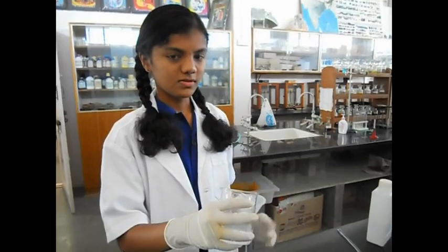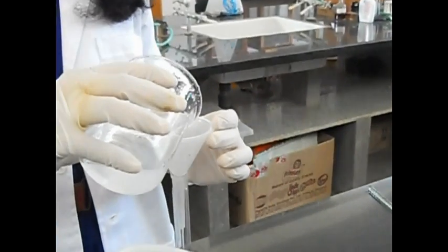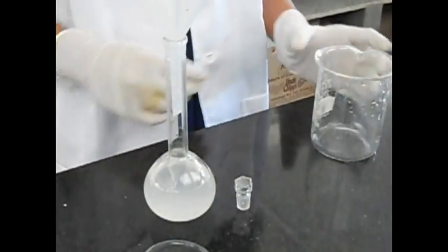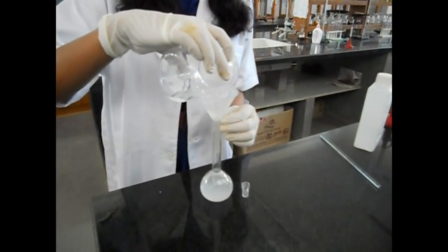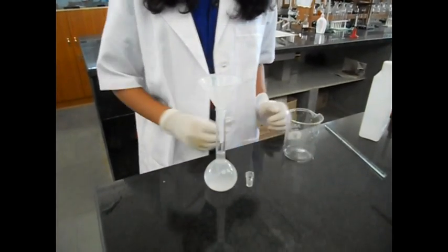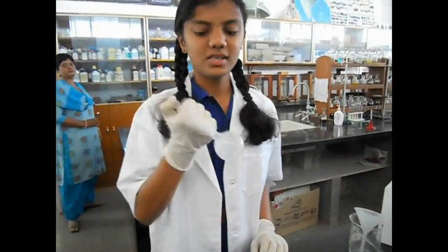Now let's transfer the solution into a 100 ml volumetric flask. Close the stopper and shake the volumetric flask.